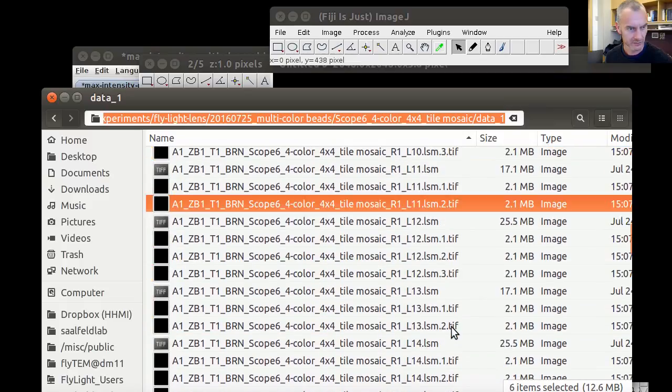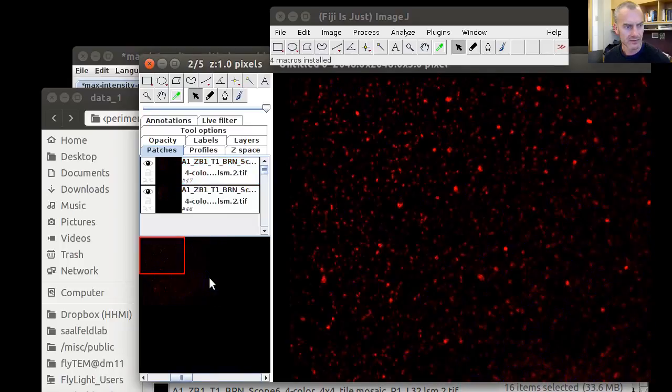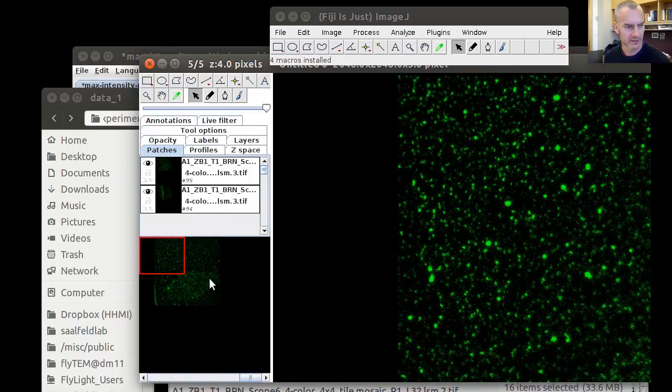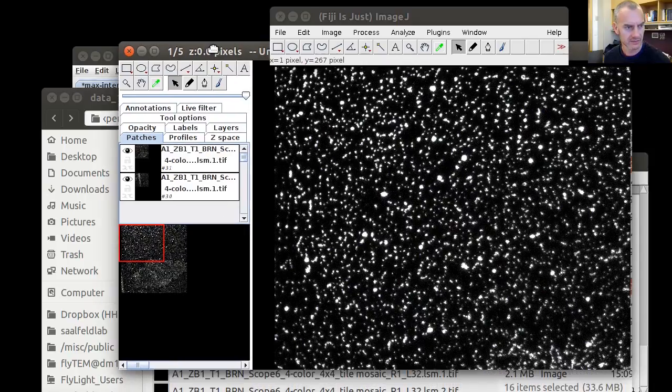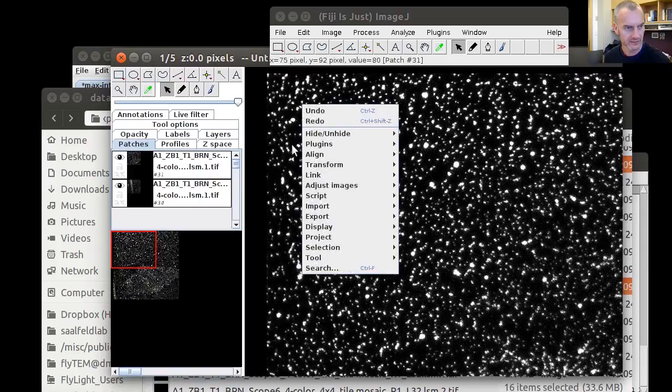And we're going to fast forward here. So now that we've imported all these channels, we see that they have different lookup tables, which is not particularly helpful in this application, and this is going to be the first thing that we're fixing after we have adjusted some project properties.